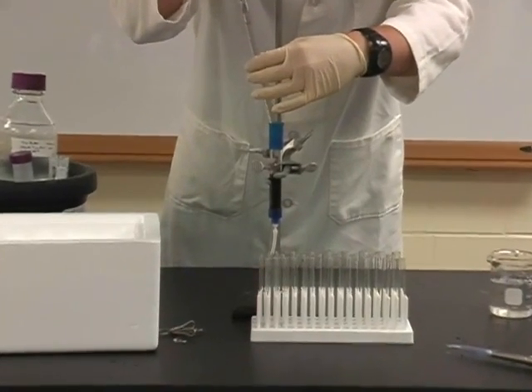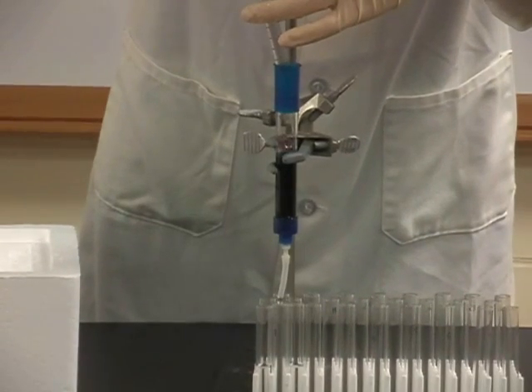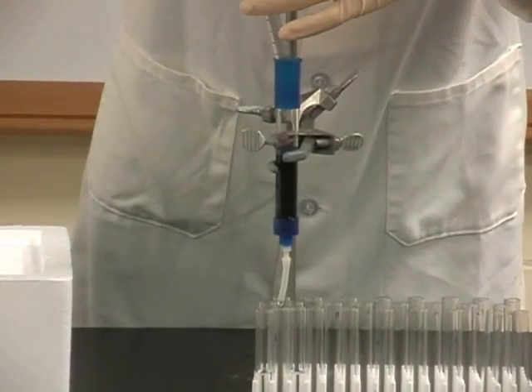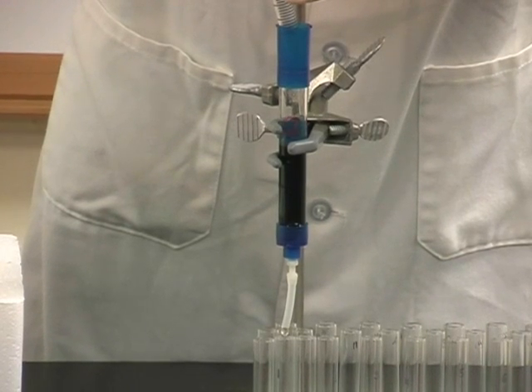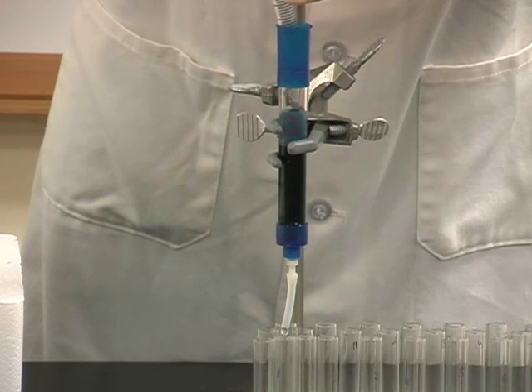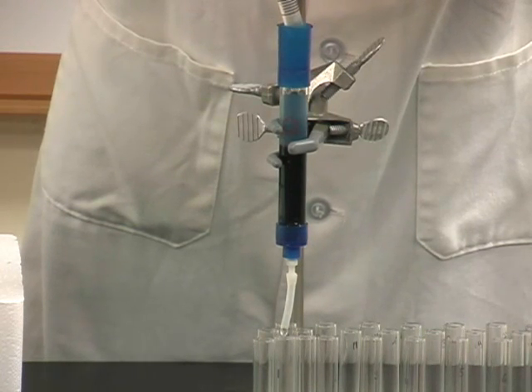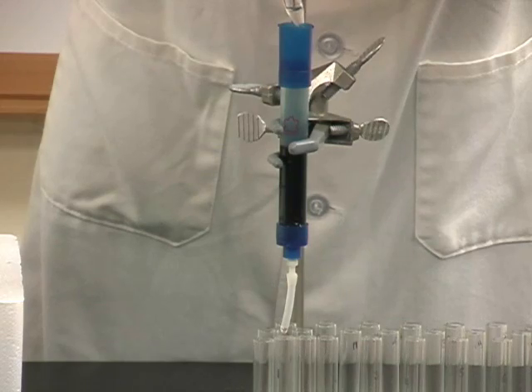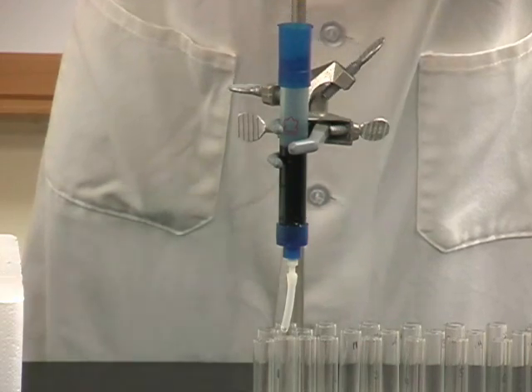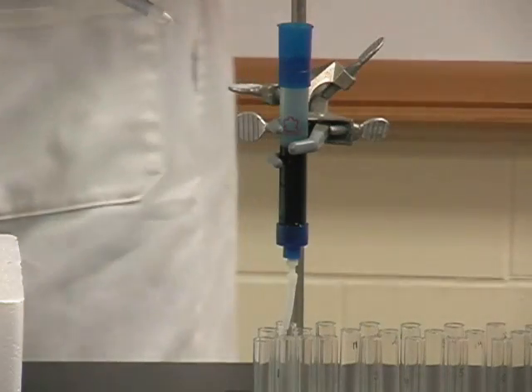The pipette is tilted slightly so that the sample drips down the side of the column instead of directly onto the top of the bed. It's important to keep the bed relatively undisturbed so that the sample can uniformly distribute throughout the bed. You can see here the dark blue beads at the bottom and the milky sample being delivered above.